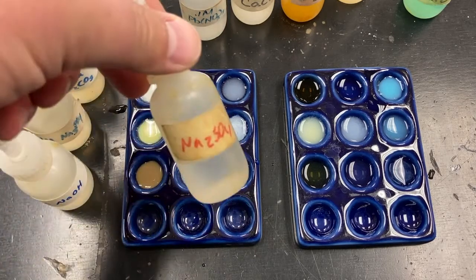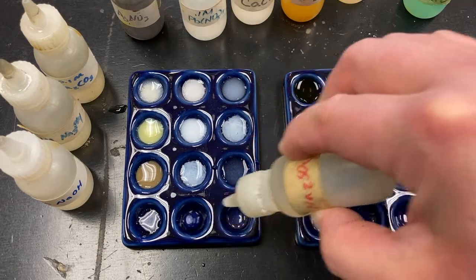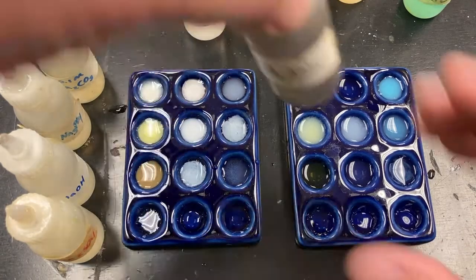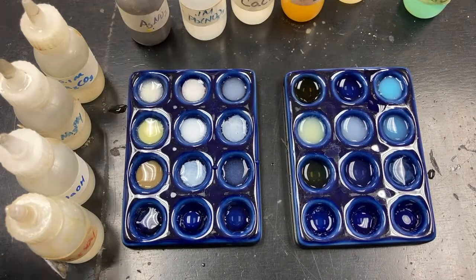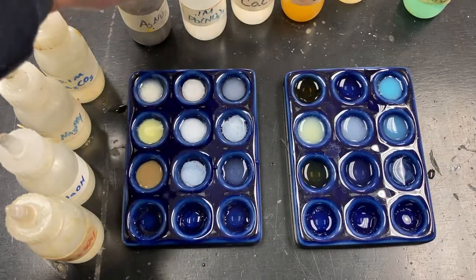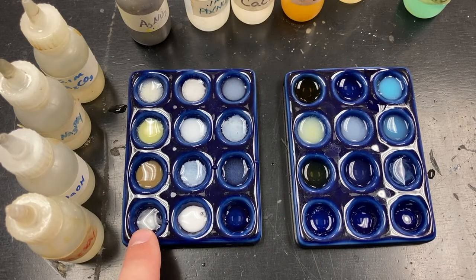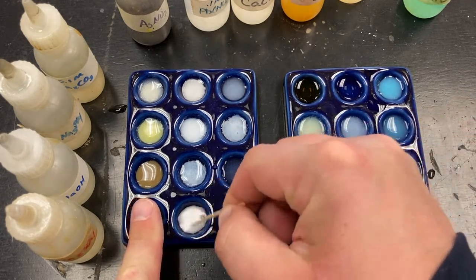Okay, last run, sodium sulfate. We're going to see if sulfates tend to form precipitates. Again, same chemicals. Doesn't appear to be anything there. Lead nitrate. Oh, disregard. I spilled a little, so disregard that. Definitely a white chunky solid.